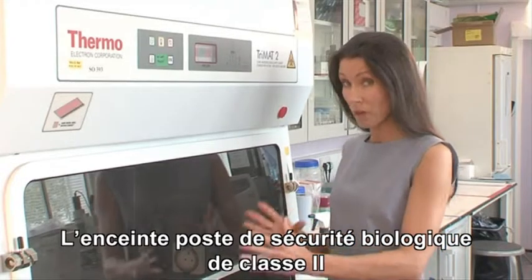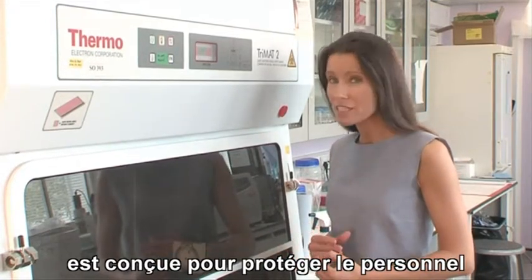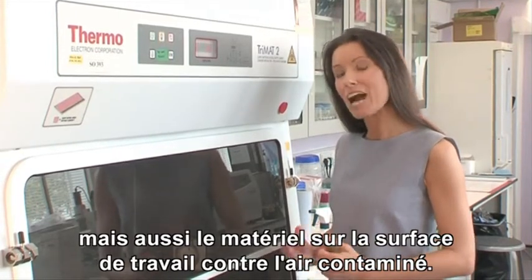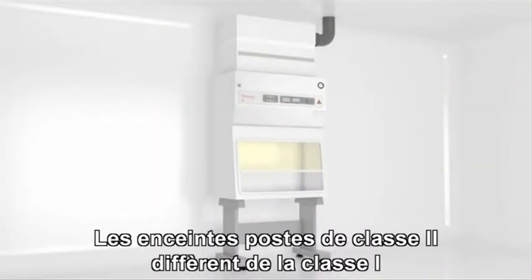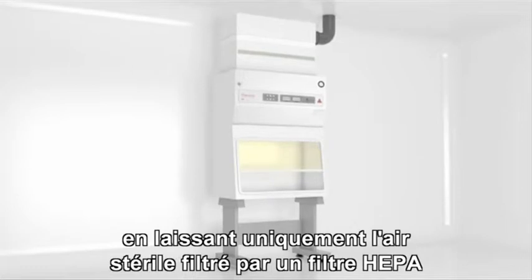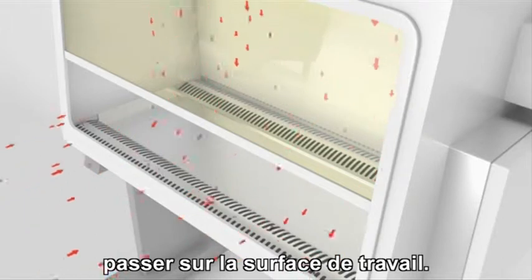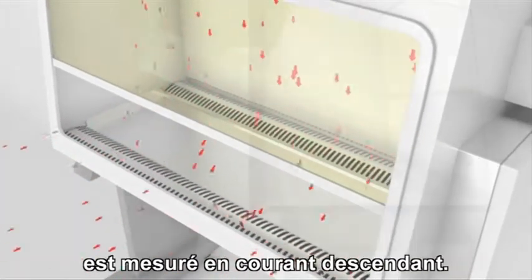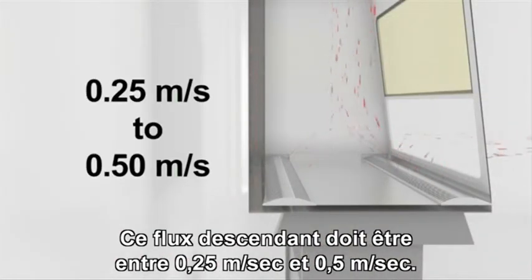The Class 2 biological safety cabinet is designed not only to provide protection for personnel, but also to protect work surface materials from contaminated room air. Class 2 cabinets differ from Class 1 by allowing only air from a HEPA-filtered sterile supply to flow over the work surface. Airflow in a Class 2 microbiological safety cabinet is measured as downflow. This downflow rate should be between 0.25 meters per second and 0.5 meters per second.